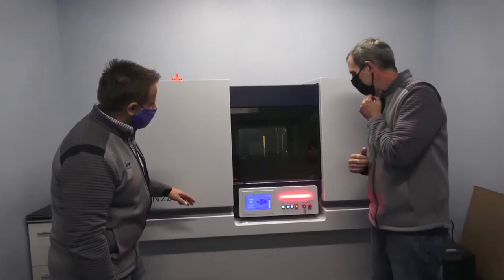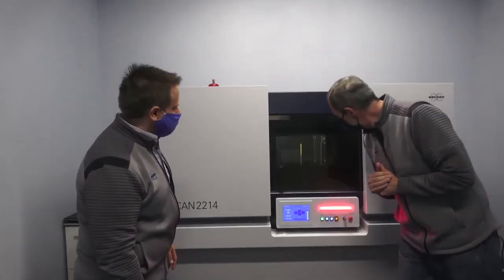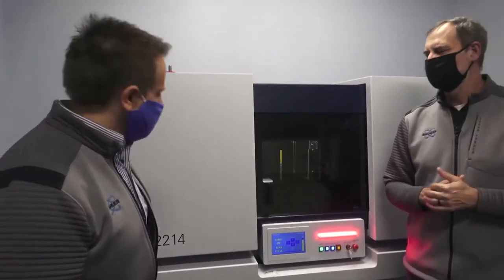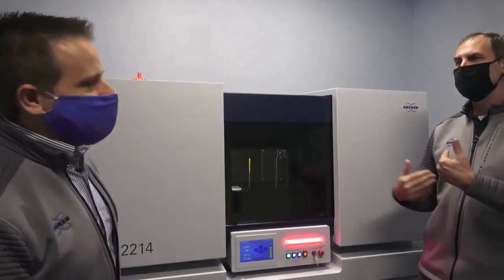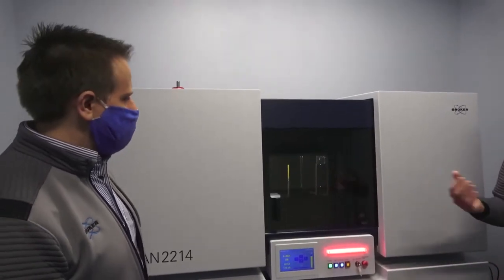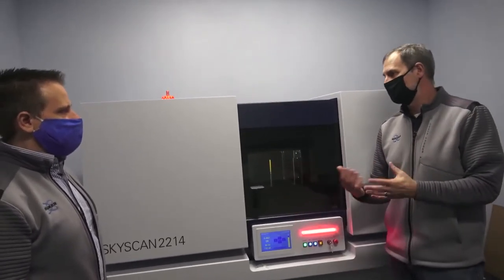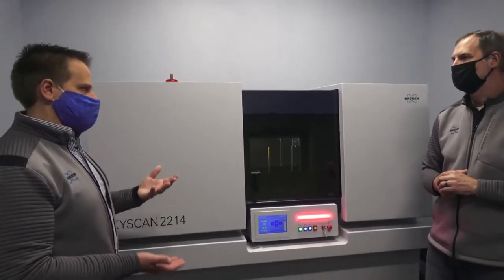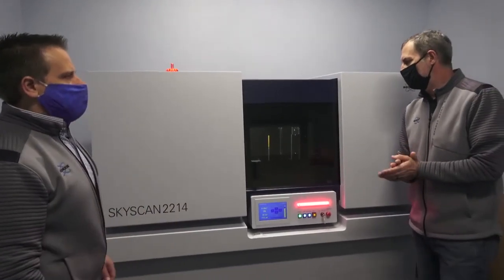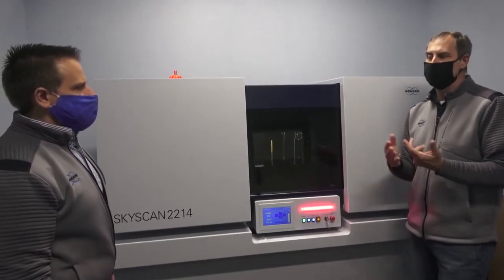The next element of resolution we talked about was actual sample positioning. Here we have the sample about two-thirds of the way back — that would be a lower resolution scan. So this looks like a pencil — it is a pencil. If we wanted higher resolution, we'd bring it forward. We have our flat panel detector as the general purpose detector, and we can switch to a higher resolution CCD detector if needed. Regarding vibrations, this machine has a lot of weight to it, plus a rigid air table — the whole system is floated on air to damp out vibrations from the room.